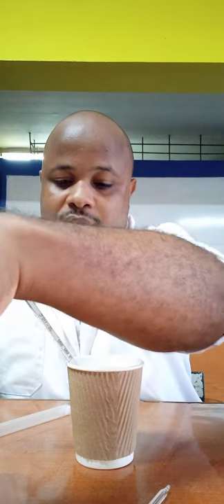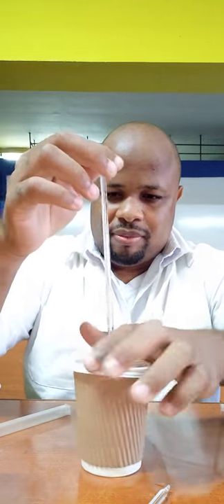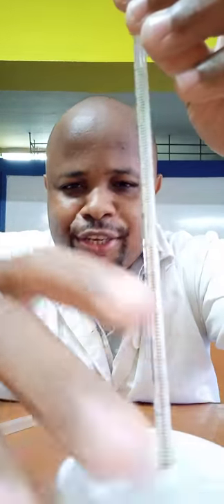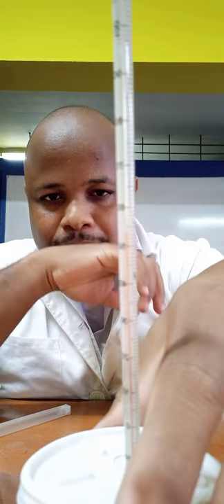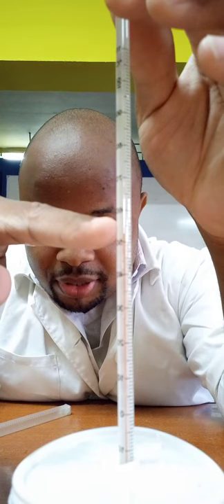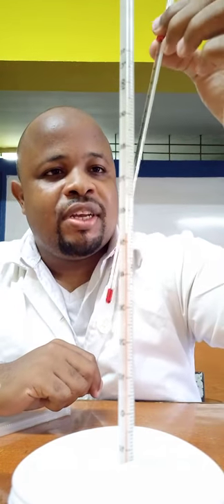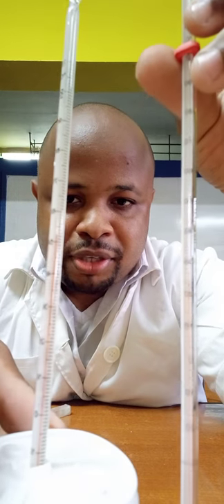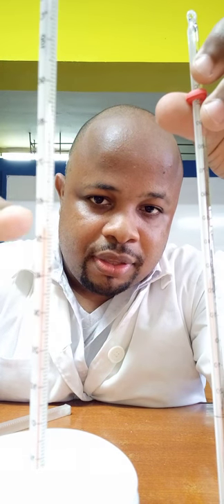I also need to cover it up. The temperature is rising rapidly — it's now at 50. I wanted you to see it as it was moving up. It's a little over 50. Just compare this line here: that one is less than 30 degrees and this one is above 50 degrees Celsius.